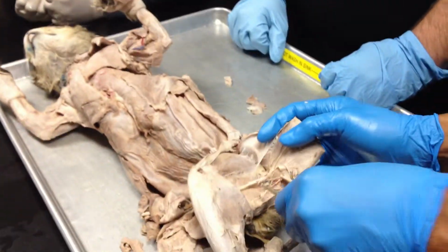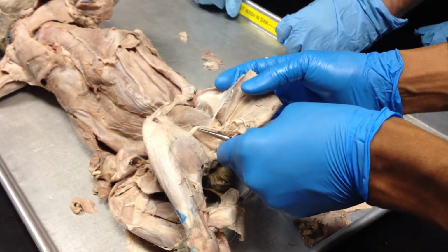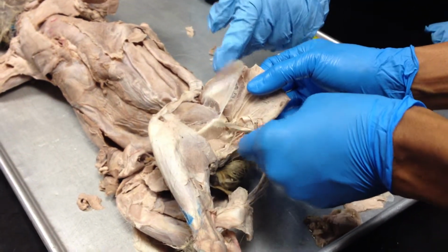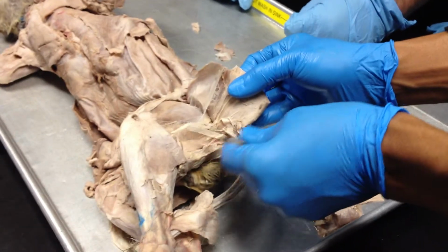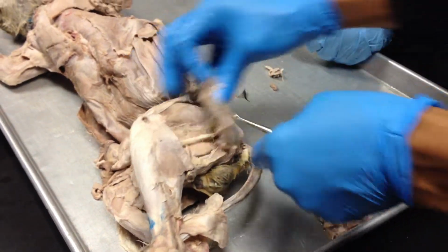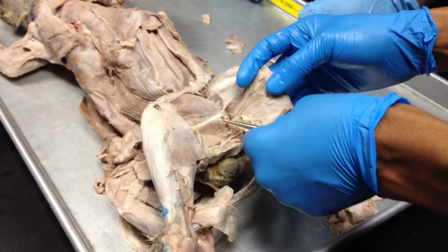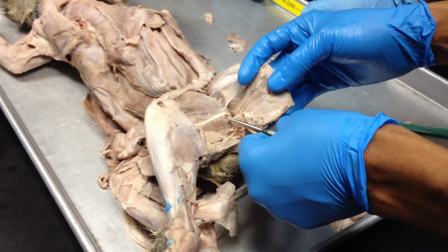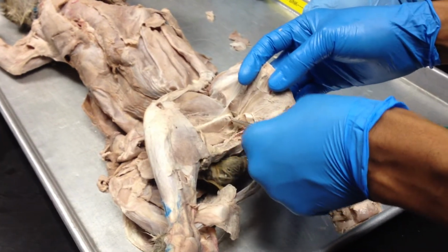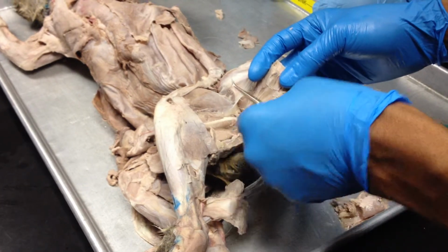Okay? And this here would be a nerve, and it's the biggest one in our body. That's just for orientation. Okay? And that's the sciatic nerve. So that's why when an intramuscular injection is being done, this is one of the nerves that you always try to avoid, because if the needle hits it, it can lead to not just pain, it can lead to damage of the nerve, inflammation, and then eventually paralysis, the worst.